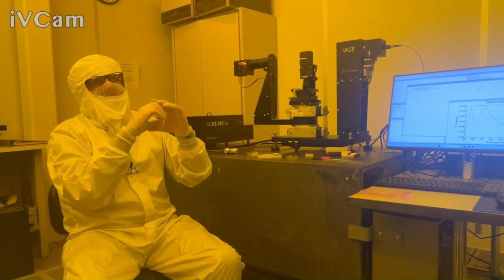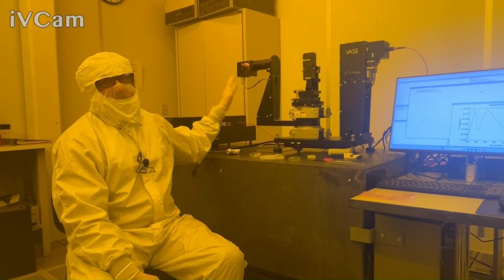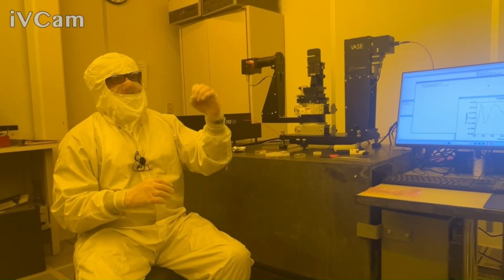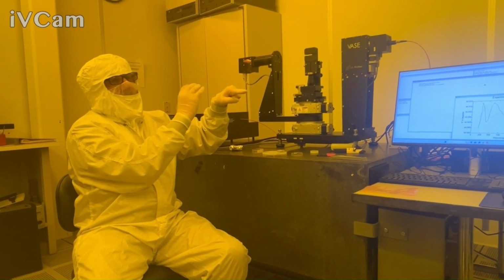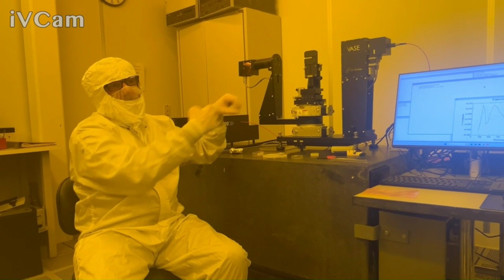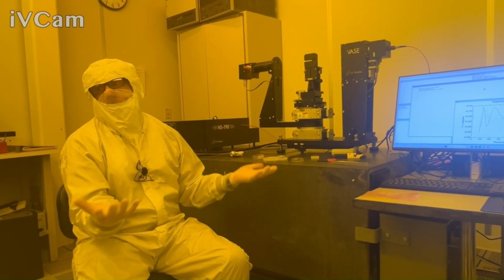We kind of throw away the edges of the beam, for various reasons. If I'm doing a pure intensity measurement, that's not advisable, because when you do your baseline measurement, your beam might be here. You put your sample on there. If your beam moves a little bit, and you're not collecting the full beam, any movement of that beam, or any drift of your lamp in between your baseline and your real measurement, is a direct error.